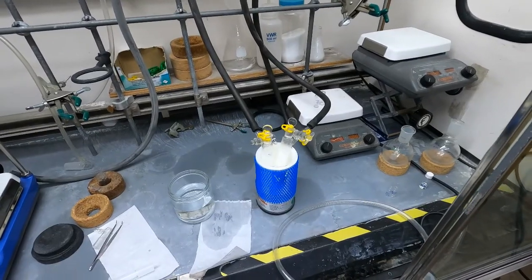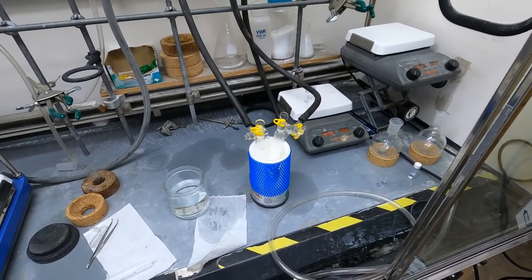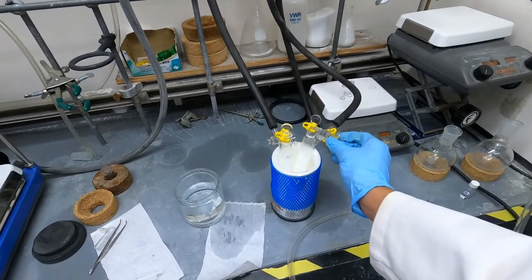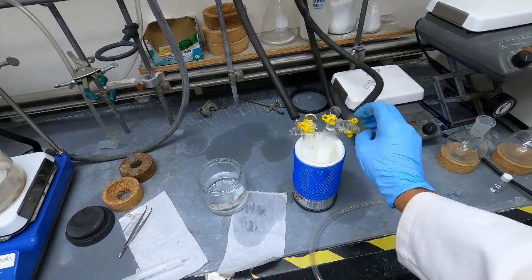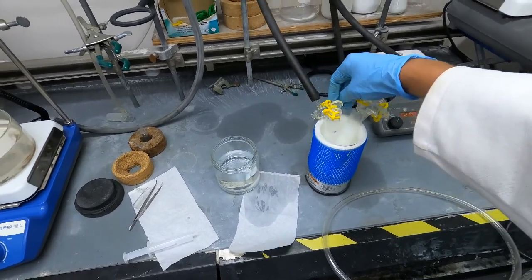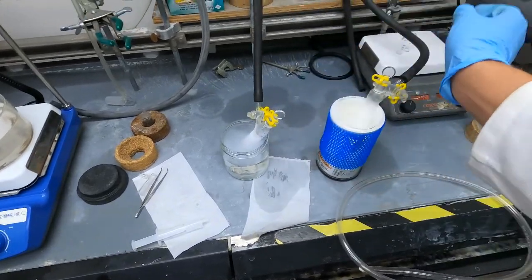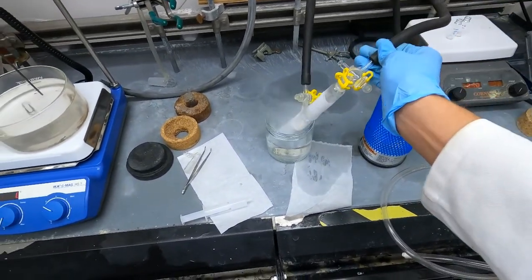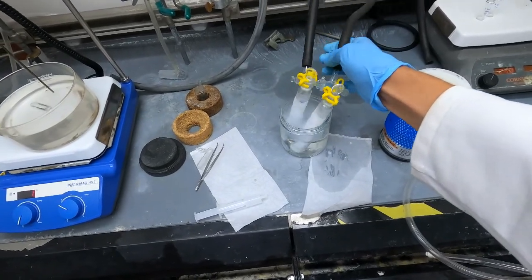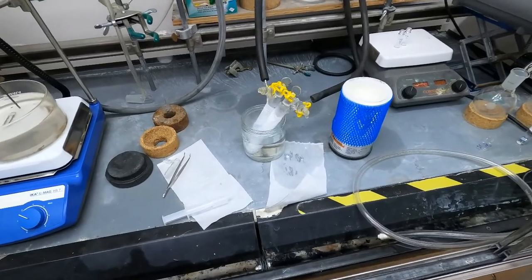We have just finished the five minutes on the last pump of the last freeze pump thaw cycle. Just like the first time I'm ready to thaw. I'm going to close the stopcocks and transfer these from the liquid nitrogen dewar and now these are fine.